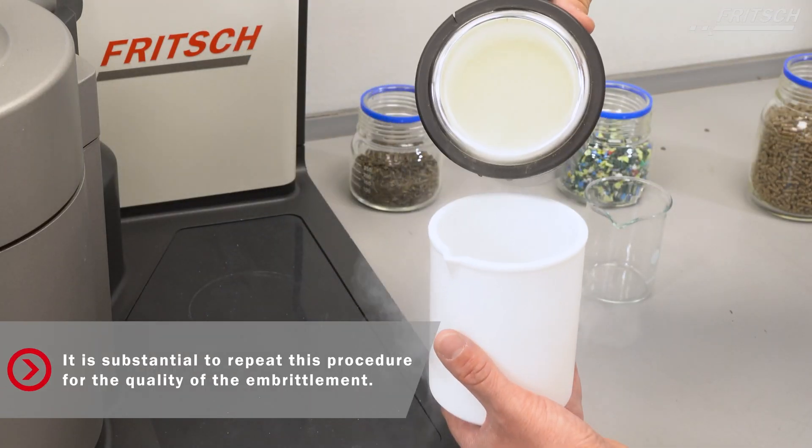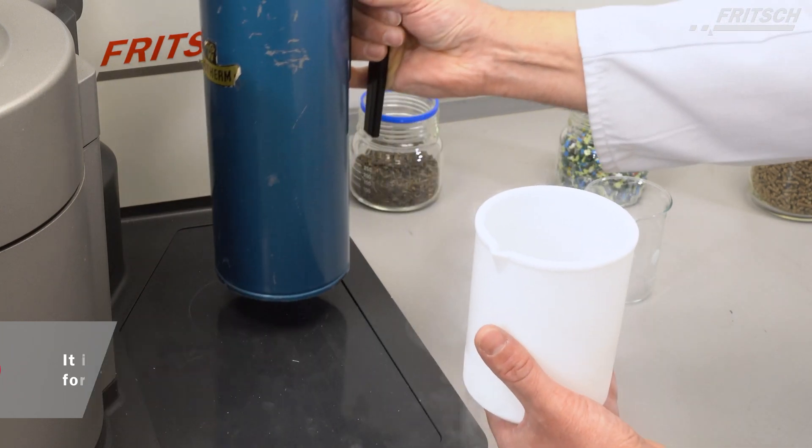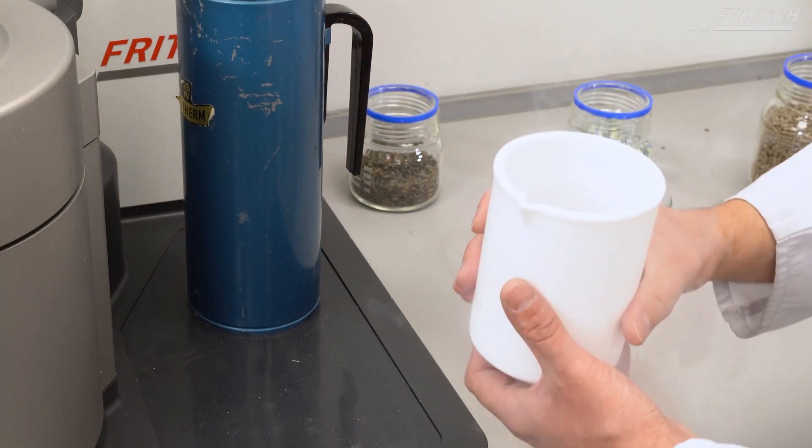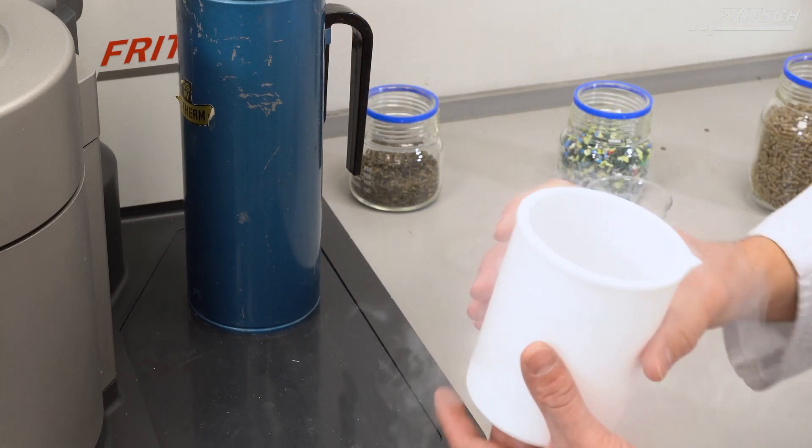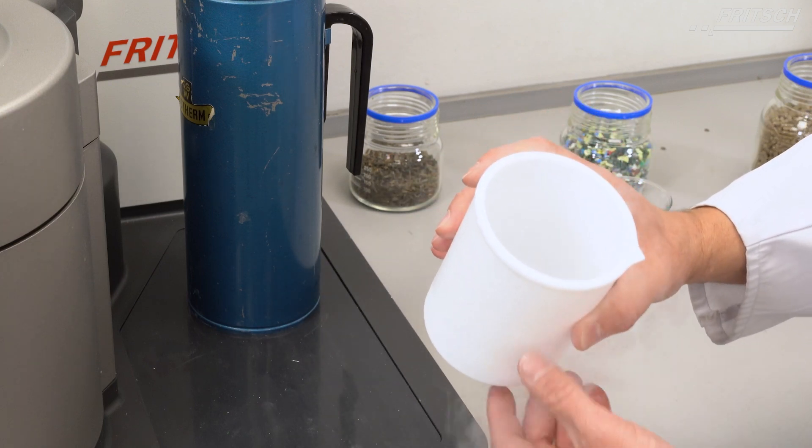The whole embrittlement step should be repeated more times to make sure that the temperature of these particles is at least minus 180 degrees or even lower.